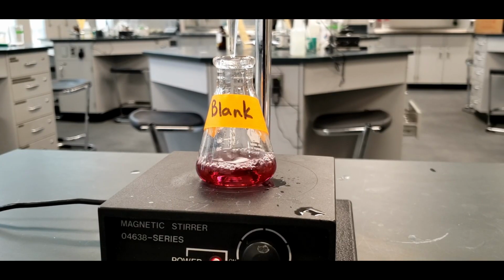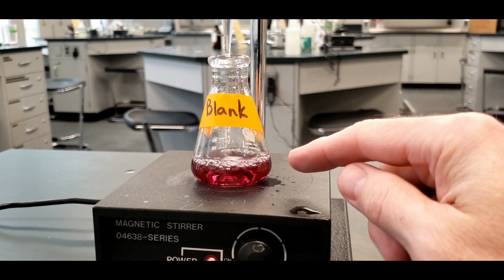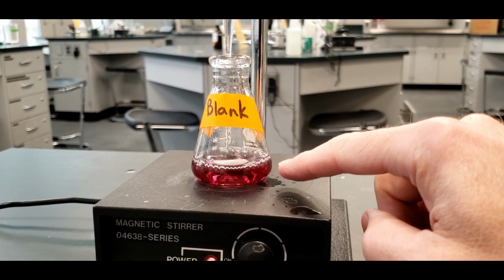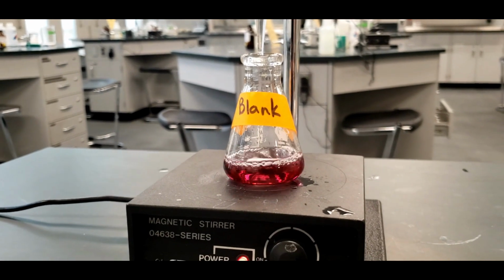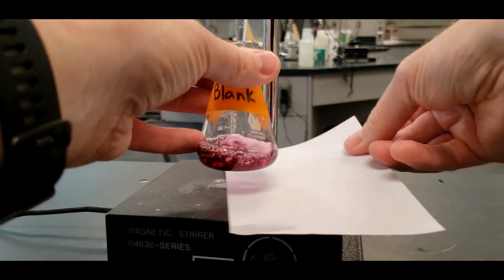All right, we're going to titrate the blank first. One thing I forgot, I noticed that I had to add in 5 mils of water to the blank as well. And that's just to increase the volume so you can see the color change better. Because without that extra 5 mils, it's a very thin layer. So that was just, it's not necessary to the reaction. It's just to allow you to see the color change better. And I'm going to put in a piece of white paper here too.